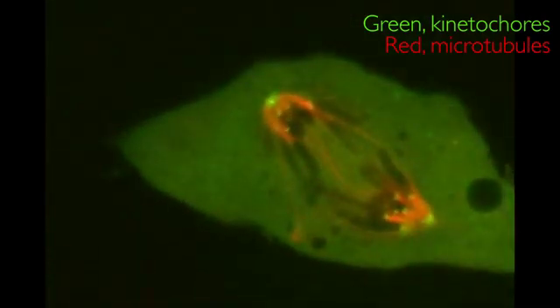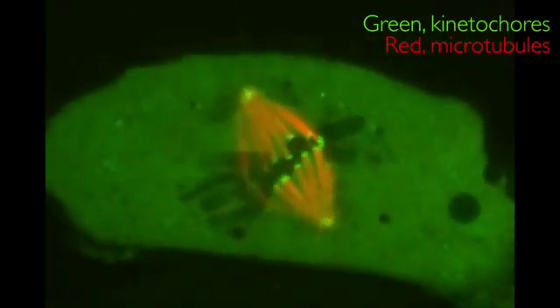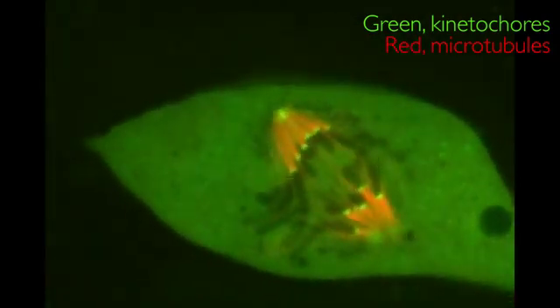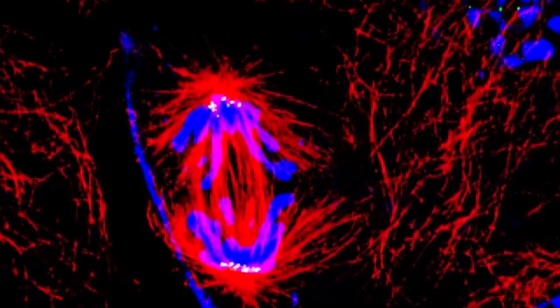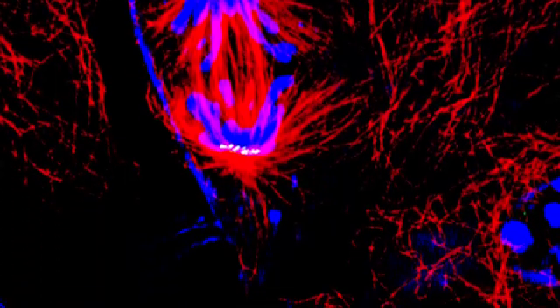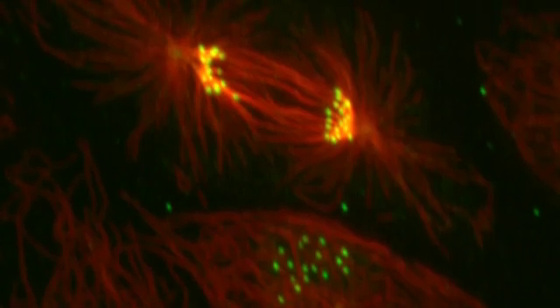The microtubules pull the chromosomes back and forth like two teams struggling in a game of tug-of-war. Then, when the bonds between the sisters are severed, the microtubules pull the chromosomes to opposite sides of the cell. Seen in this perspective, even a normal cell division begins to look really exciting.